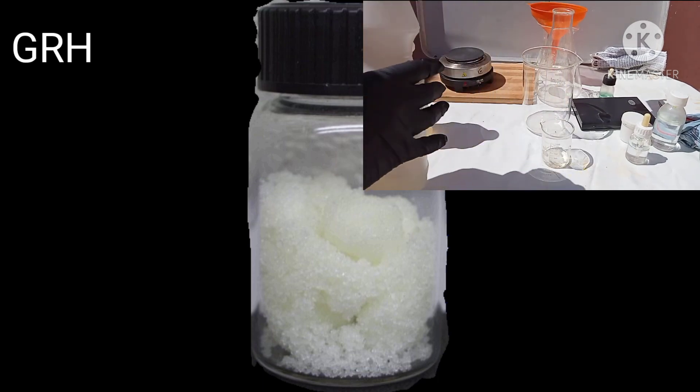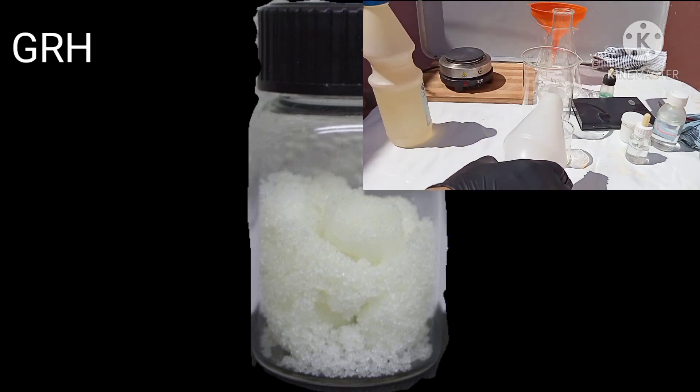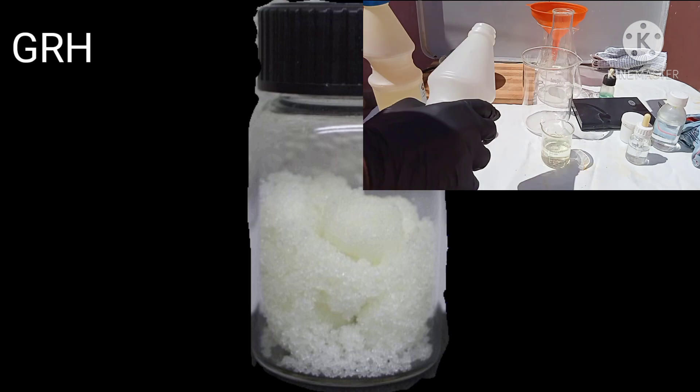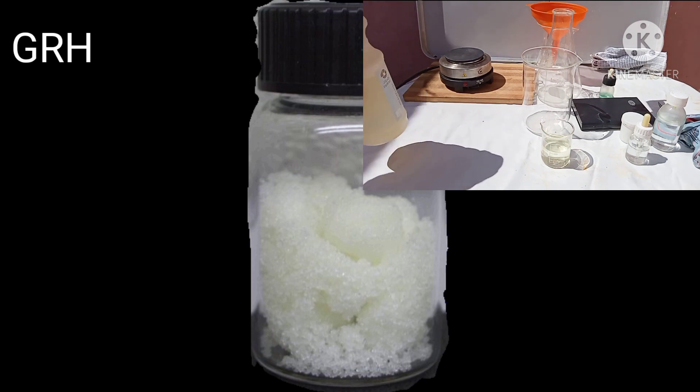At the outset, you have two choices. You can simply add the sodium nitrite as a solid — powdered or in lumps — or you can dissolve it first in some warm water. Add a little of it at a time while stirring. When the gold starts to appear, add a pinch of excess sodium nitrite.